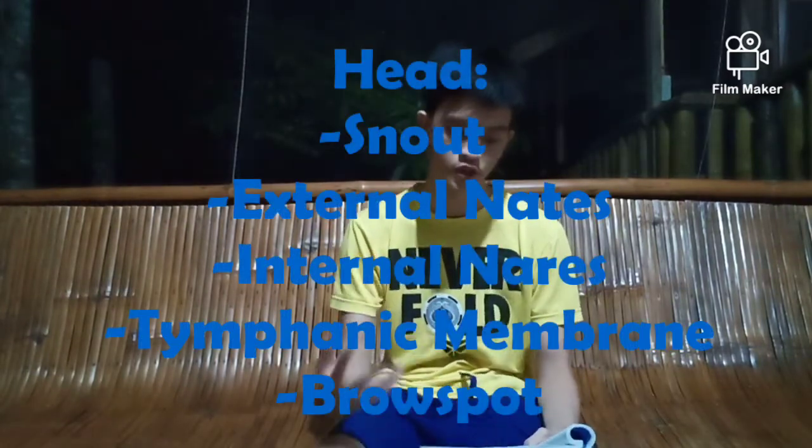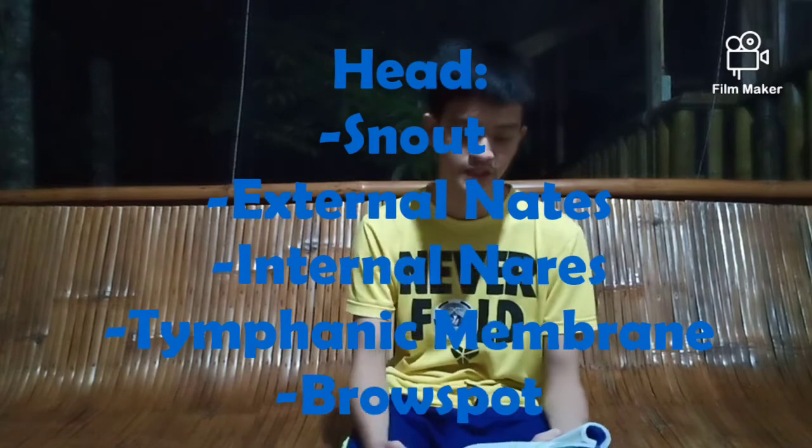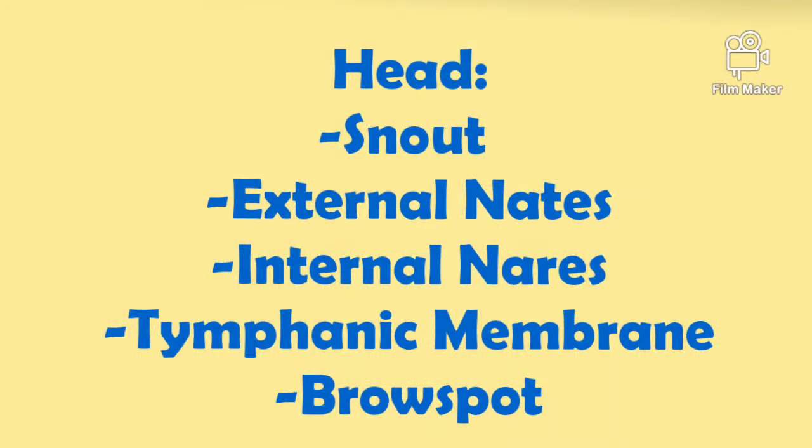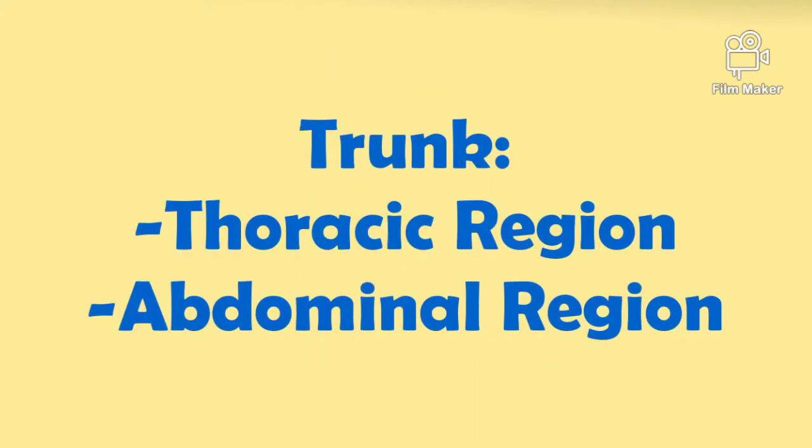Now let's talk about the axial region of the frog itself. The axial region is composed of the head and the trunk. Under the head, there are multiple body parts, such as the snout, the external nares, the eyes, the tympanic membrane, and the brow spot. The trunk, the part of the body posterior to the head, has two main parts: the thoracic or chest region, and the abdominal or lumbar region.